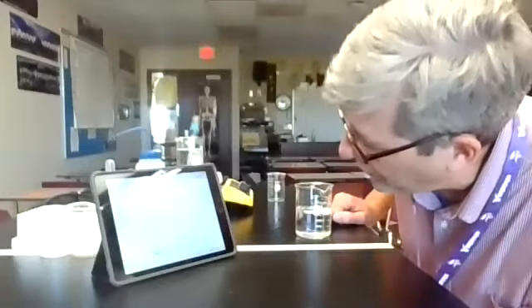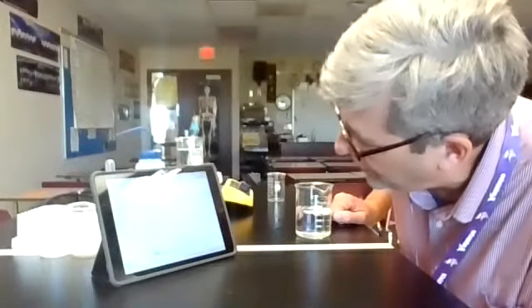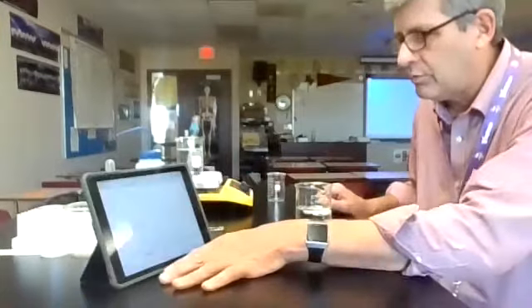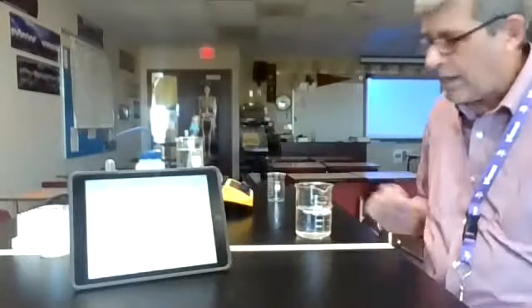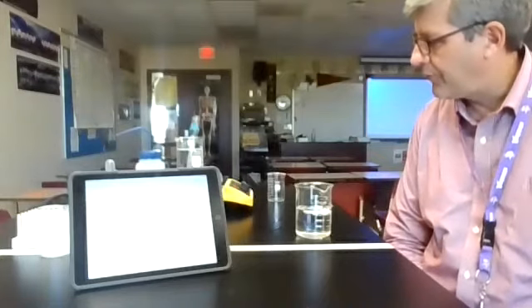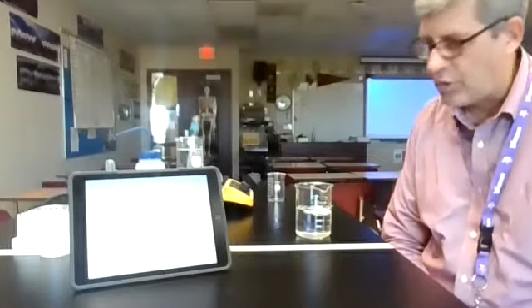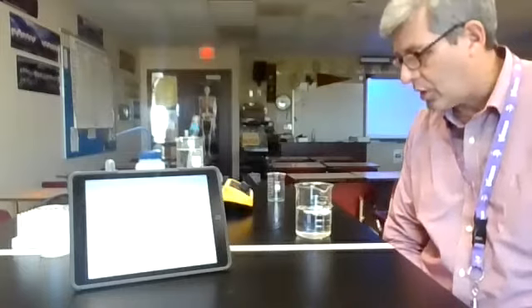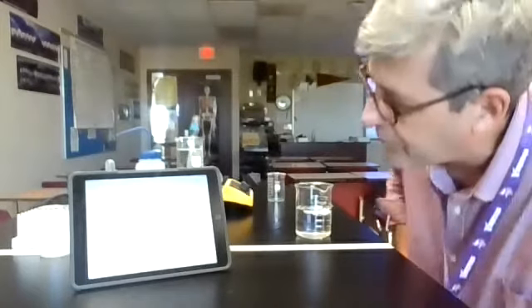Now the temperature's really started to go up. We can see it getting closer and closer to 80 degrees Celsius. So I'm going to let it go for another minute or two until it does get up to 80. Don't worry if you can't see it as well as you would like, I will make sure that this file gets attached to our instruction page, and you can upload this right into Graphical Analysis 4, and you should also be able to see what's going on there.